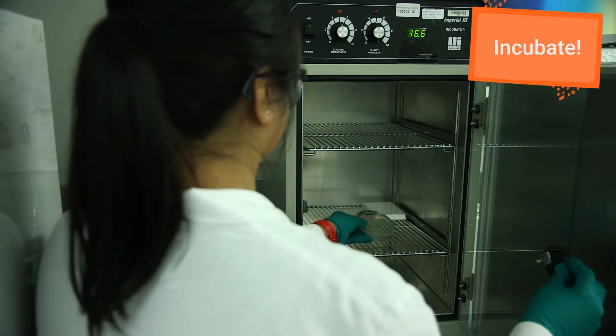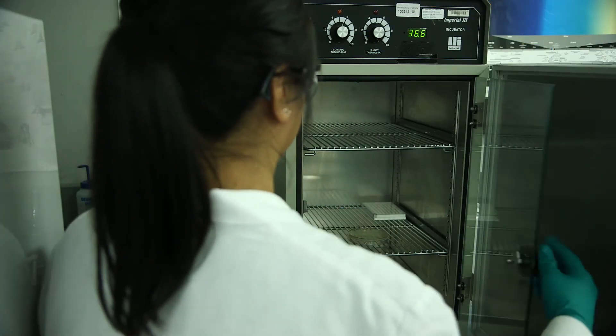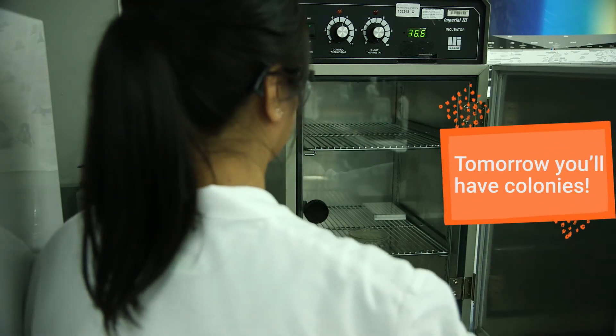Incubate the plates at 37 degrees Celsius overnight. Tomorrow you should be able to pick colonies of transformed cells.